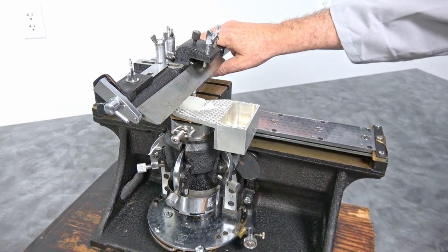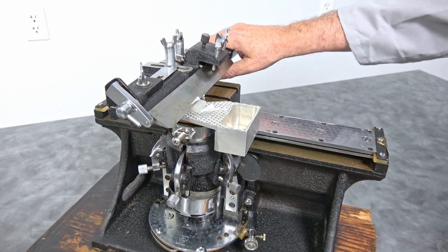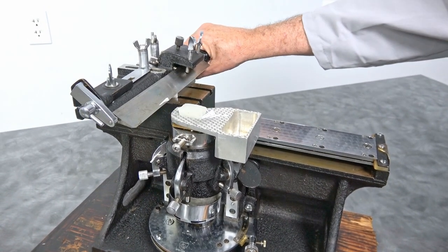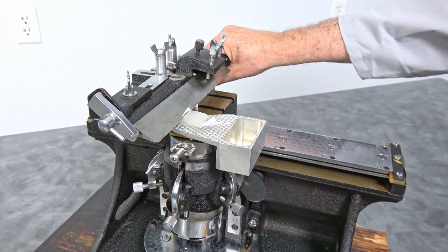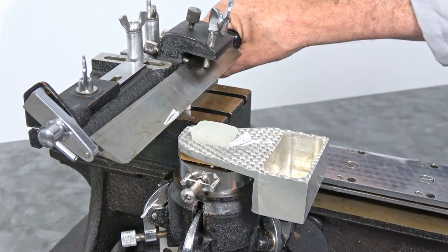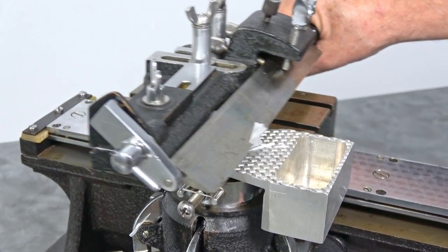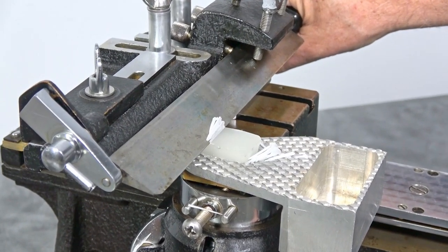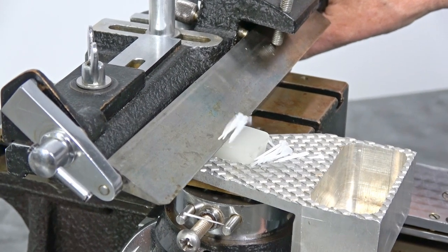As you pull it, it will slide that up and if I had a brush I could get that. I don't have the sample well surfaced yet, but as you can see it's doing a nice uniform cut.